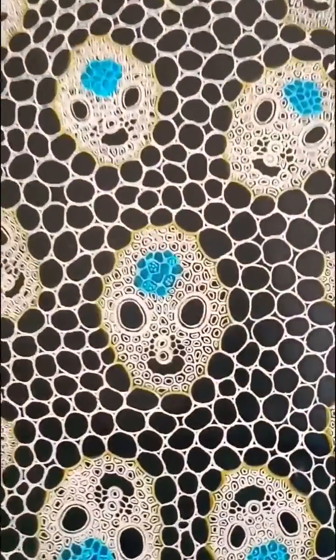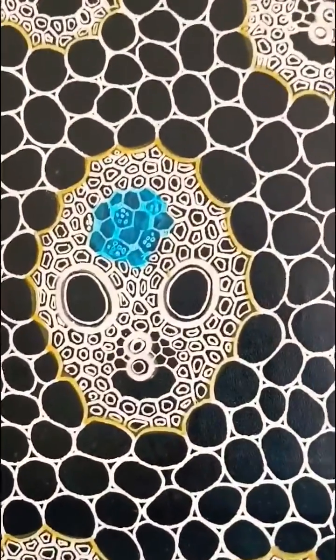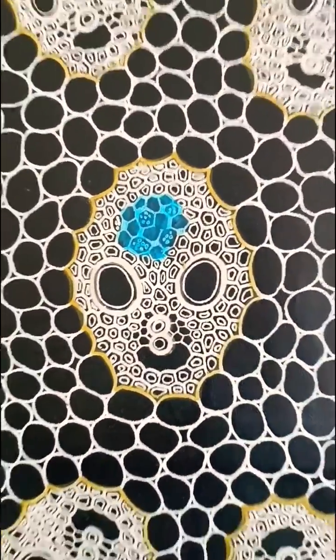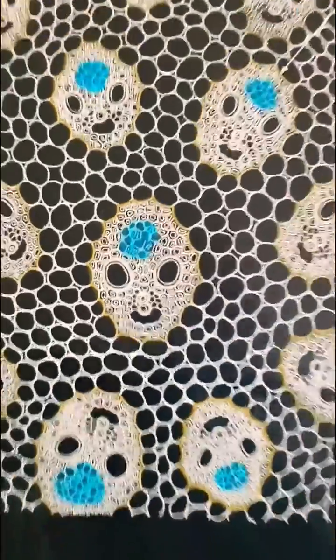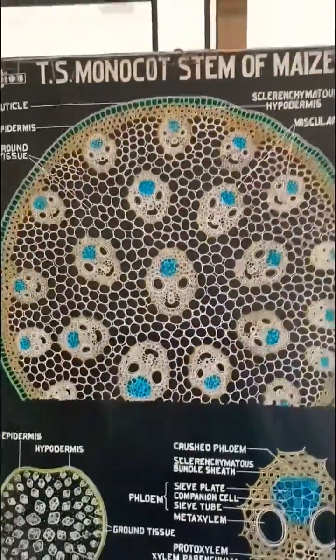You can see here the protoxylem — small holes towards the centre — and the bigger holes, metaxylem, towards the periphery. That's why it is stem.